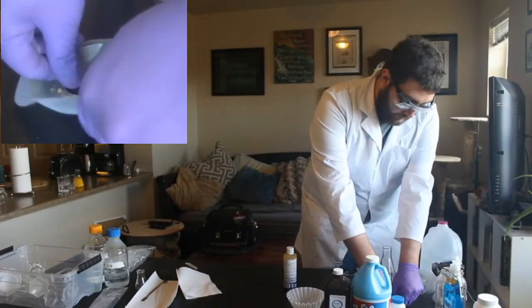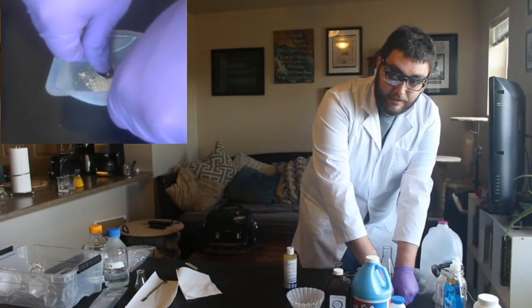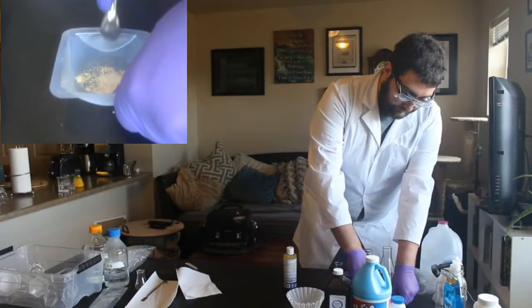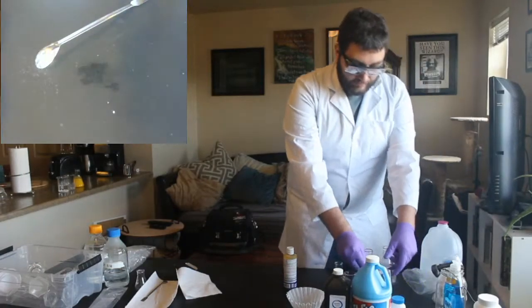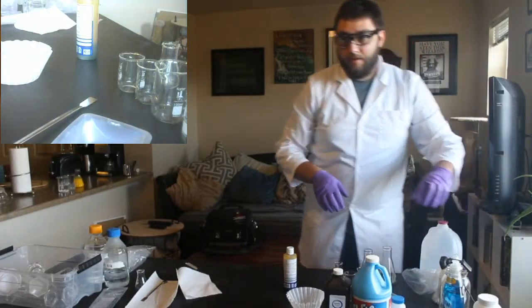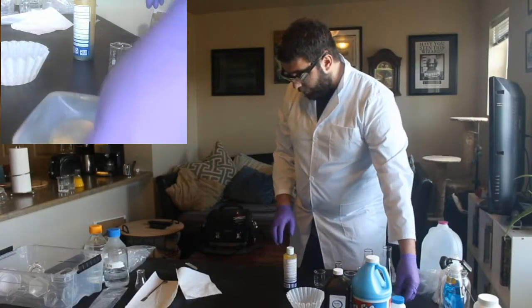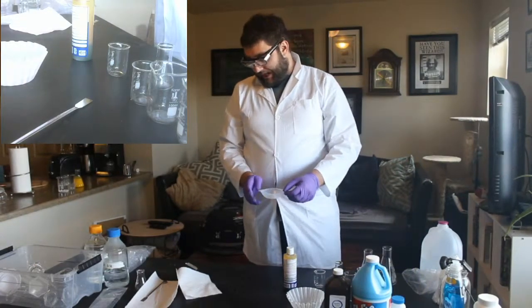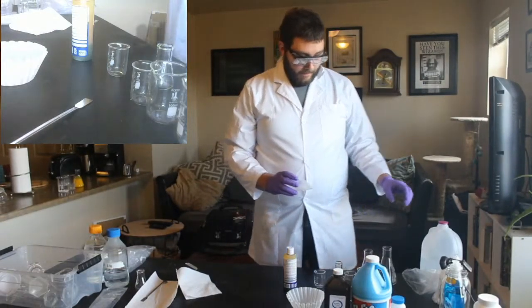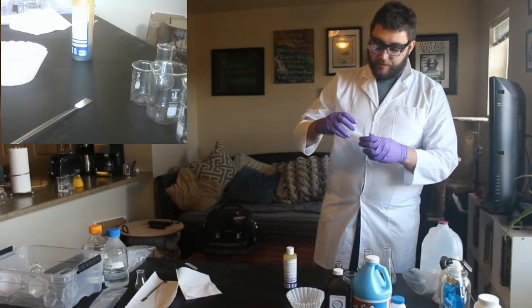Okay. We want to try to get as many of the chunks as possible. And then once we have that, now we're going to mix that with some water. And we're going to mix one tablet with about 2 ounces of water. And you can use your best judgment here.